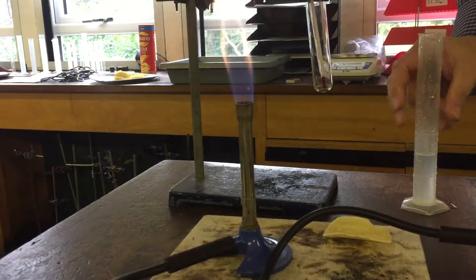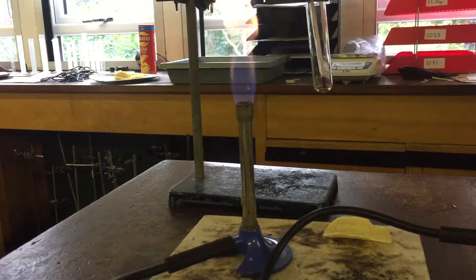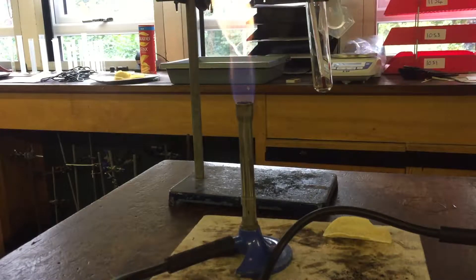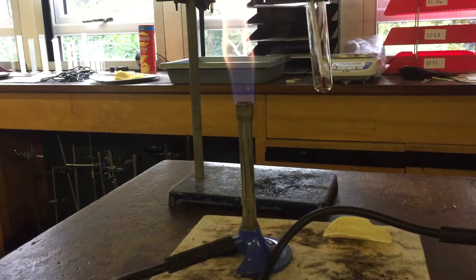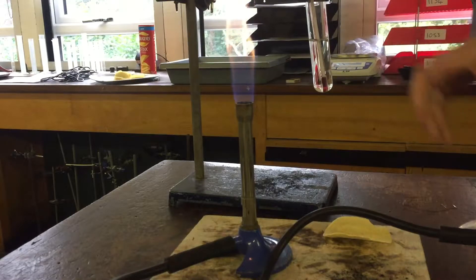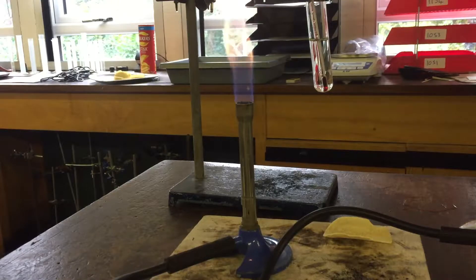We have 20 millilitres of water measured with a measuring cylinder. Put the water into the boiling tube. Take one of the long thermometers — don't take the short ones, they'll be too short. Take a long thermometer and then we're ready to go.